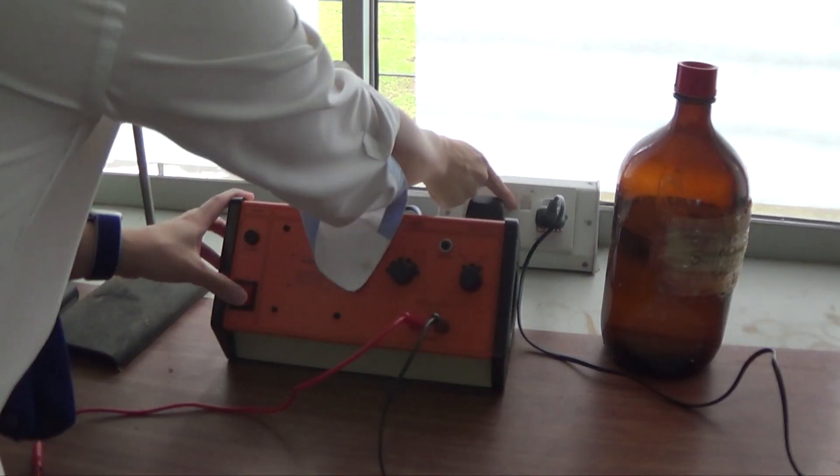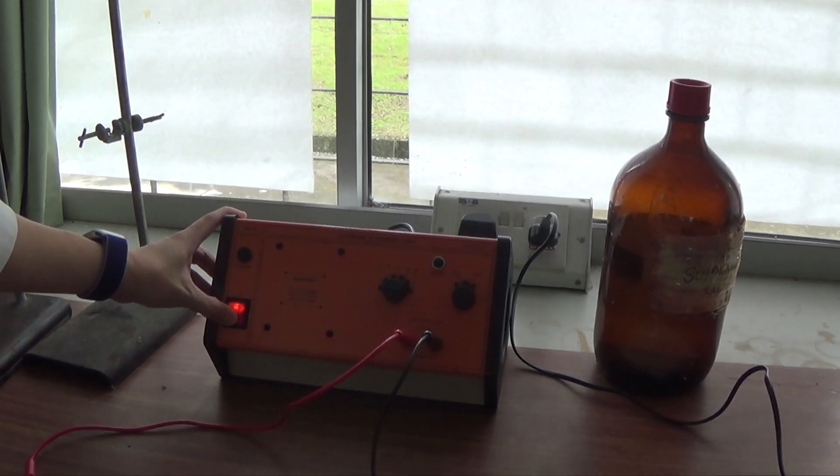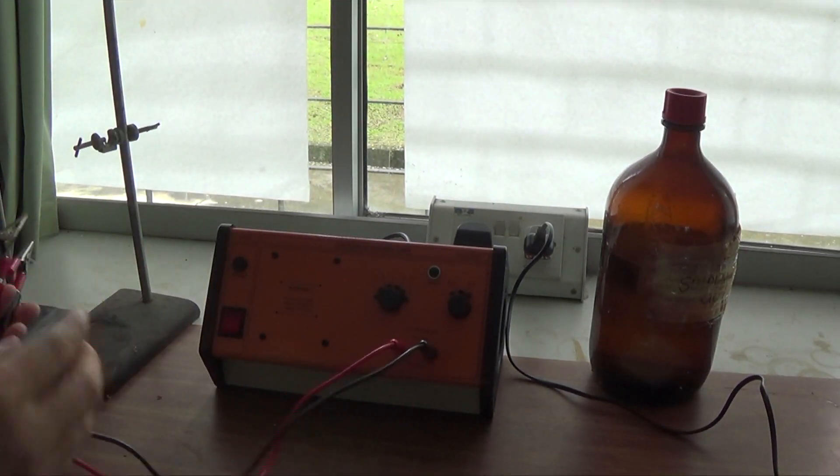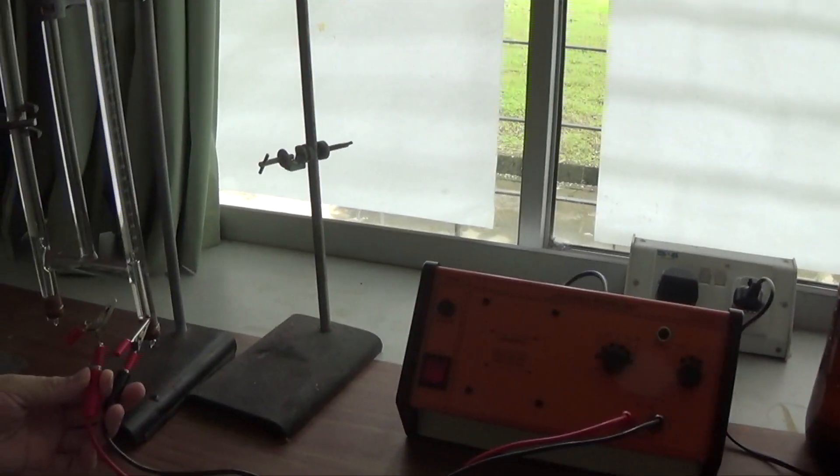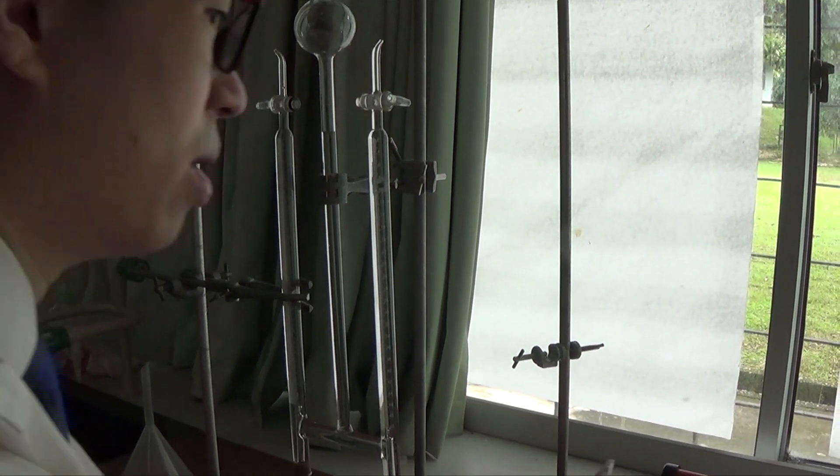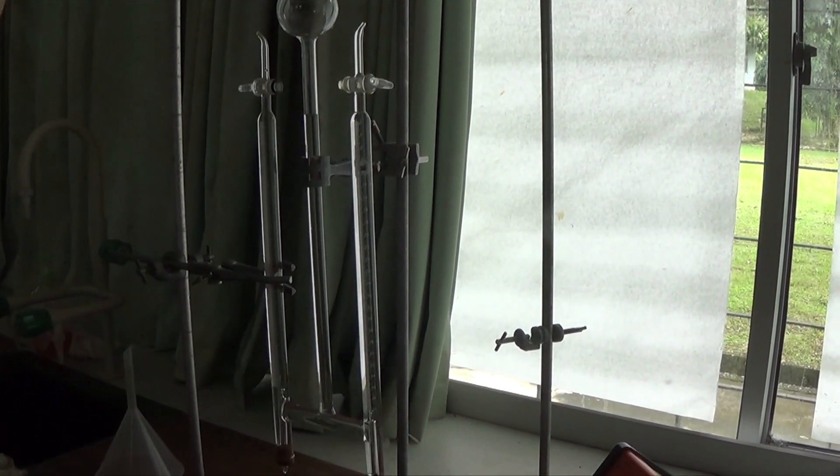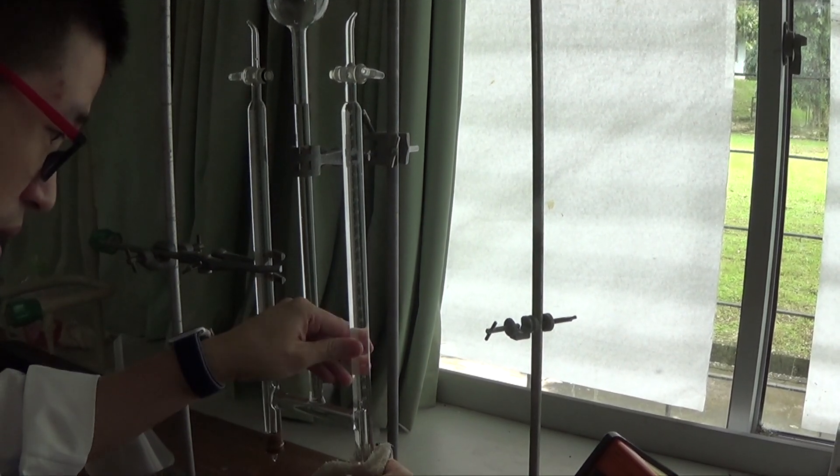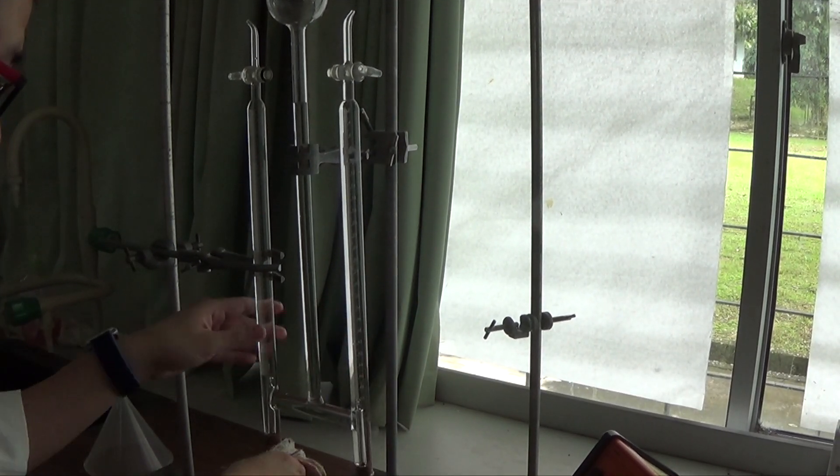We have a power pack here. Power is on. I'm just going to put this onto the setup here. So you'll be dealing with electricity. You got to be very sure that you take every single precaution possible.